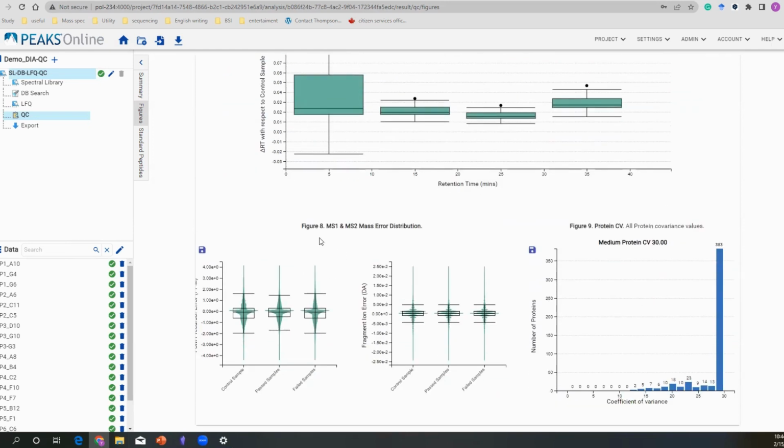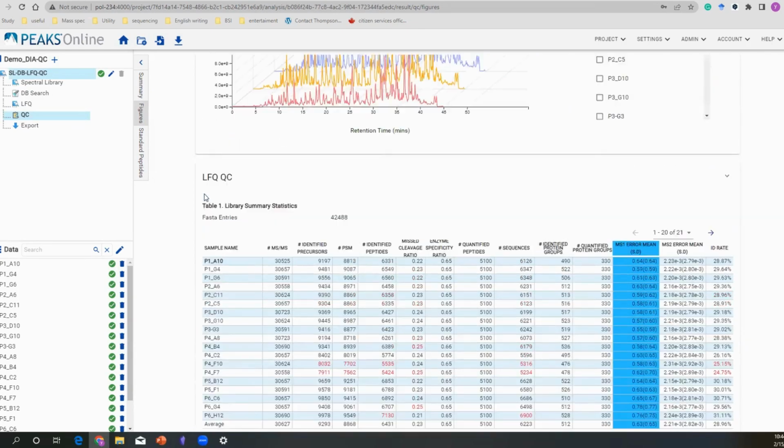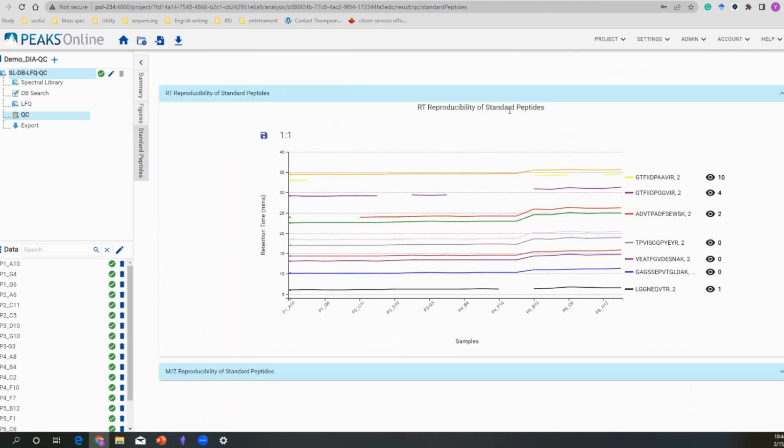And in here are our MS1, MS2, and MS errors. Your samples are separated into different groups, pass and failed. Also, for quantification purposes, we give out a CV value of your protein. So this page is all about untargeted analysis. And for the standard peptides tab, we give out the targeted analysis.